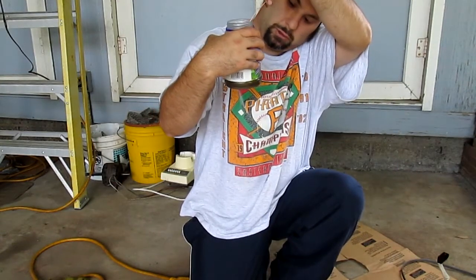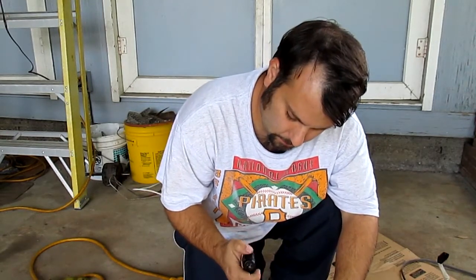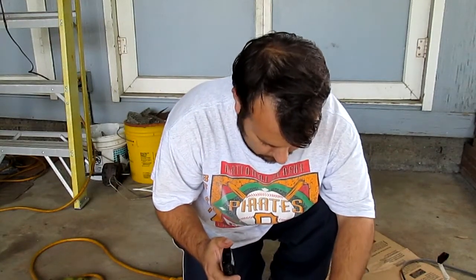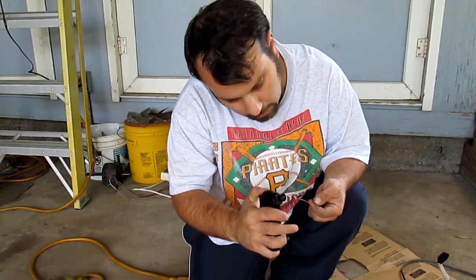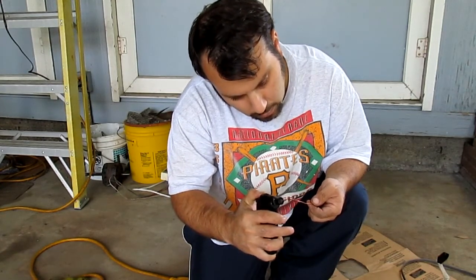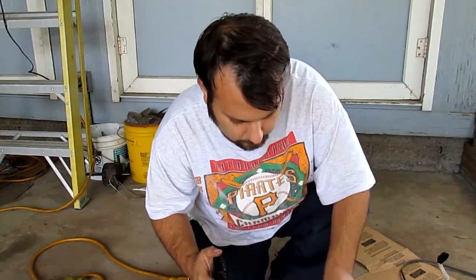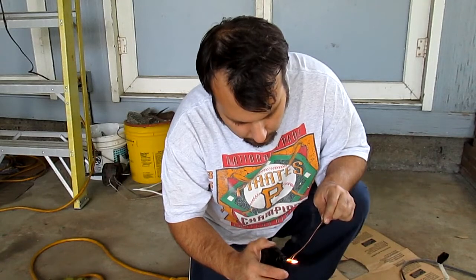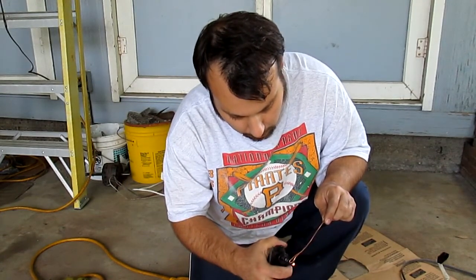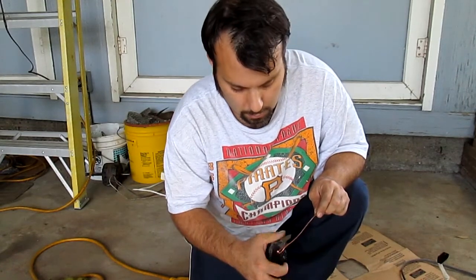There's about a whole quart of oil in there. And I have a small propane butane torch here — that's all I got, so we're going to go ahead and try it. I coated the wire in oil. And the idea behind it is, when you heat the wire, I don't know how well you're getting to see this. I don't know if you're getting to see that flame coming off of there or not, but that's the oil burning. And as you can see, it's pretty much an orange flame.